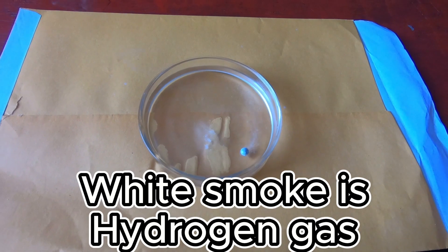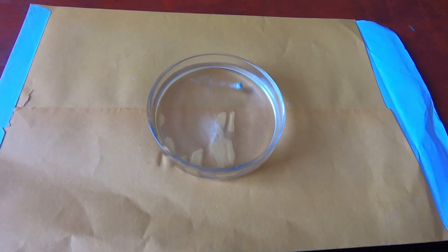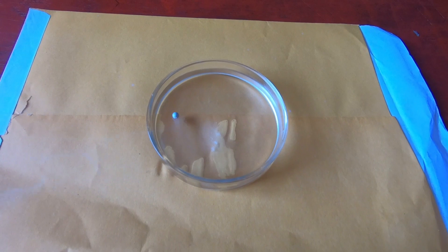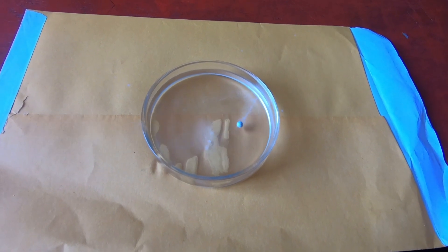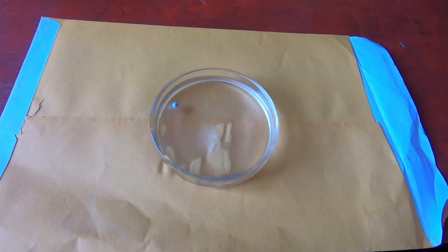We would observe the fizzing and we see the metal floats on water and we see a white trail is formed. Those are all common for potassium as well, but this is with sodium.